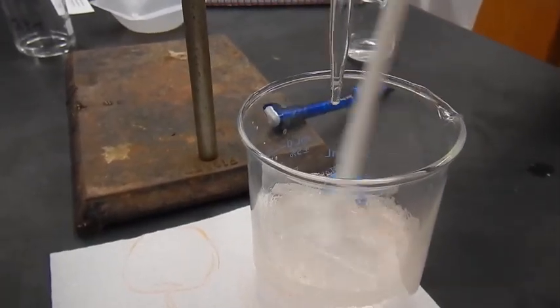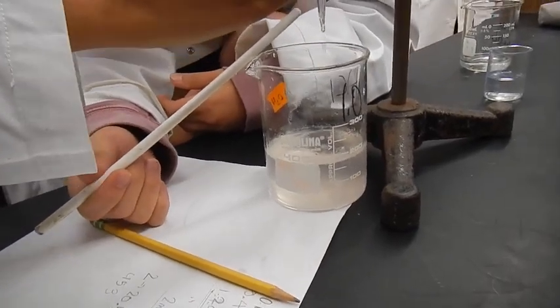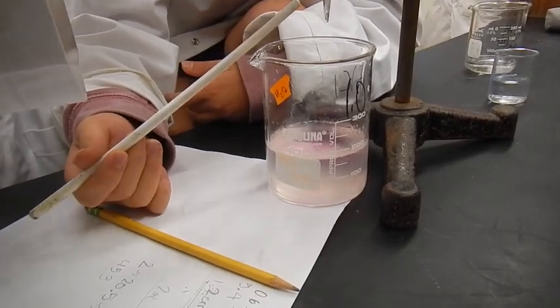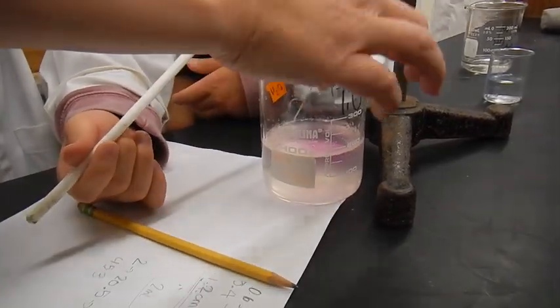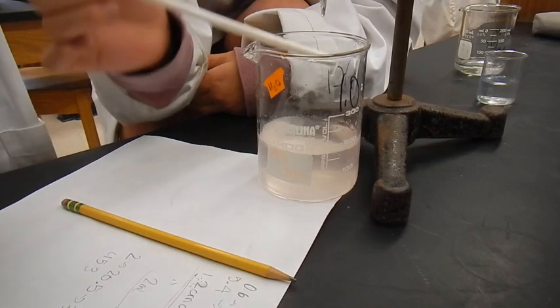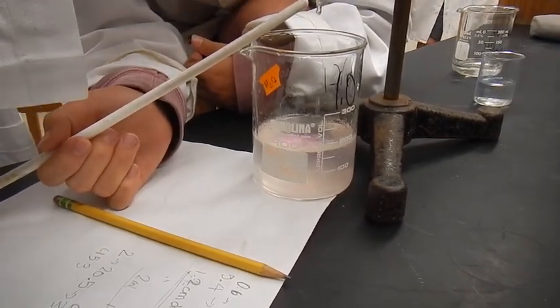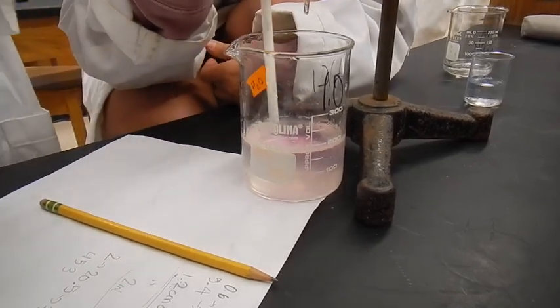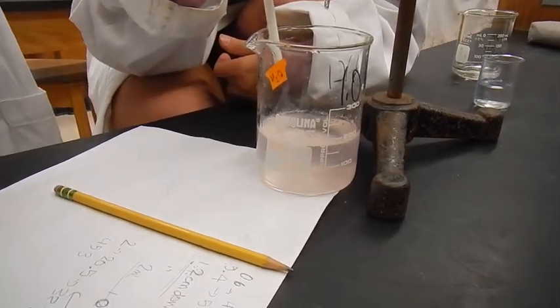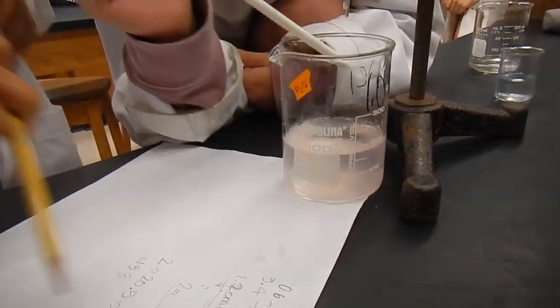The foam's getting pink. But the whole solution isn't really changing color yet. Do you keep going? Yeah. Pinker, right? Don't lump your mistakes with us, guys. Rude. Here, let me take a pH just to verify. Yeah. Yeah, you guys are close. Somehow you added acid. Go ahead and clean up. Is that pink? Is that like pink? I'm kidding. We got to get it. We did it. So take a reading. So look at their data.